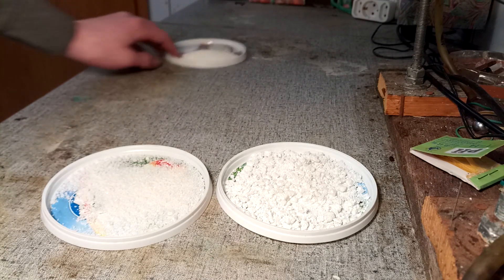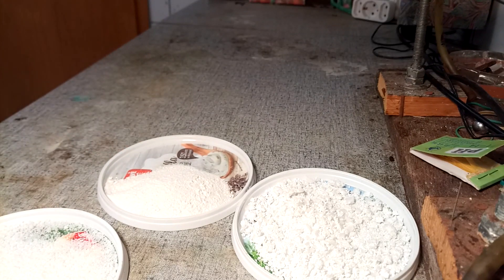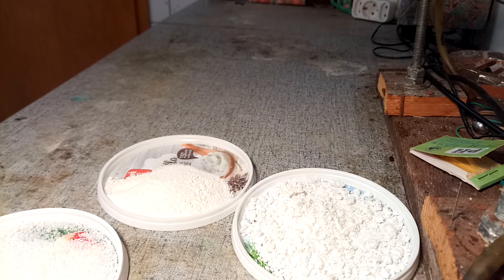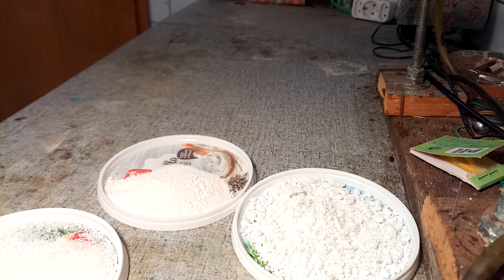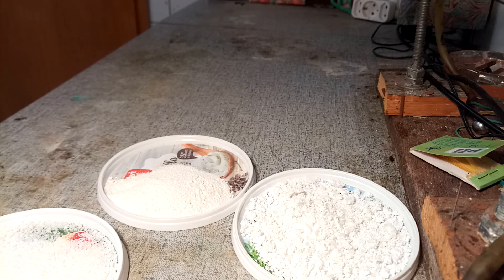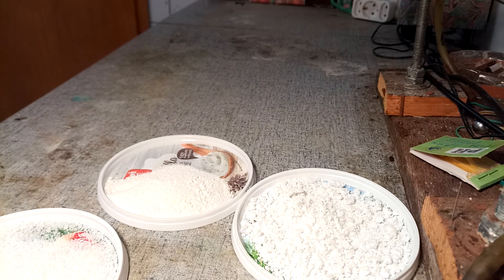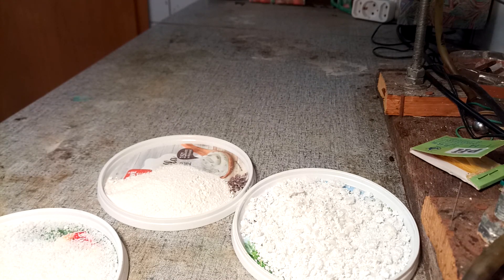Lastly, we have the product — our 47 percent sodium nitrite as we just determined it. However, there is only 37.1 grams of it, so that's not too good. If we calculate a yield on this, based on the fact it's 47 percent, we get a yield of 21.5 percent, which is pretty depressing to say the least.